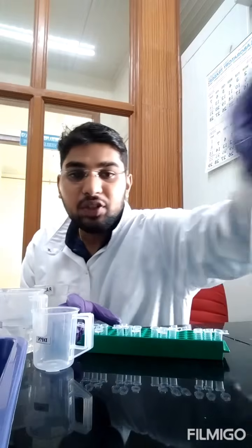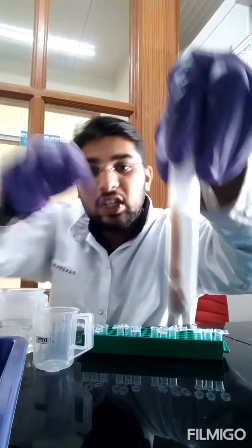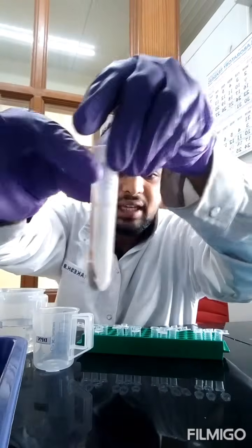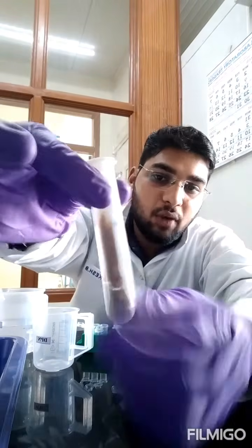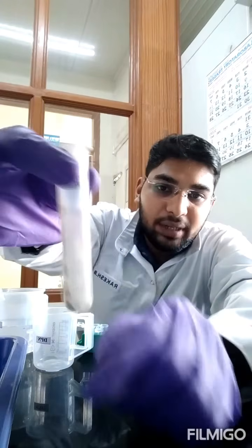You can see if you centrifuge how the pellets are formed on the walls of the centrifugation tube. This is the cellular debris that we are not supposed to take. So without any shaking, we have to transfer this clear supernatant. We have to avoid the pellet, cell wall debris and all the other debris. So we will transfer this supernatant into the test tube, carefully without mixing the cell debris.